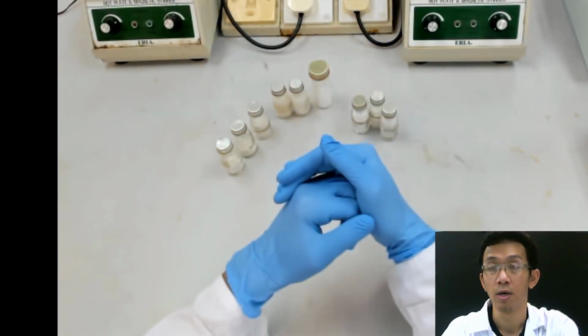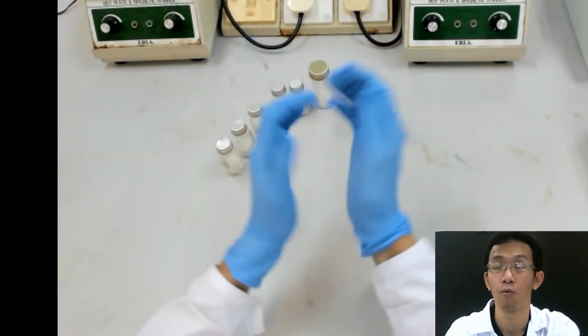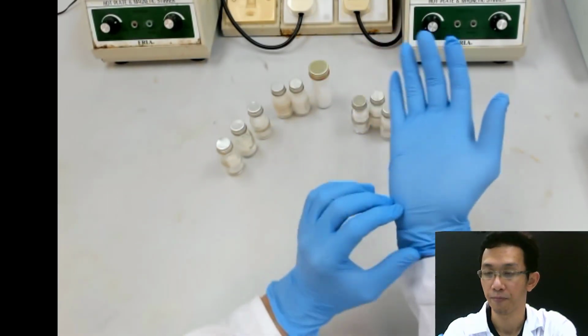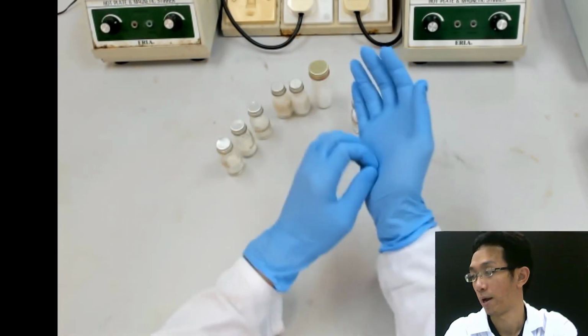Later on, when you receive the video from Dr. Raha, you will see that Dr. Raha will use, what we call, the white glove. Okay, but of course the nitrile glove is much more expensive than the white glove.